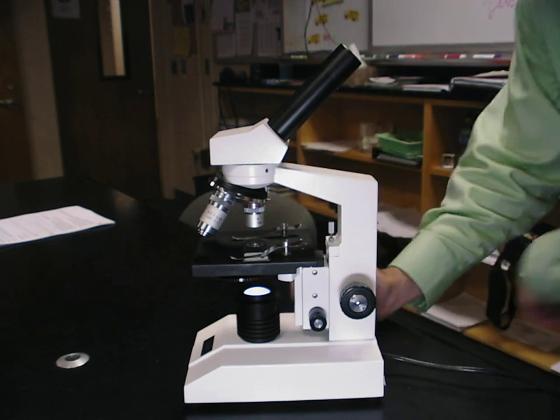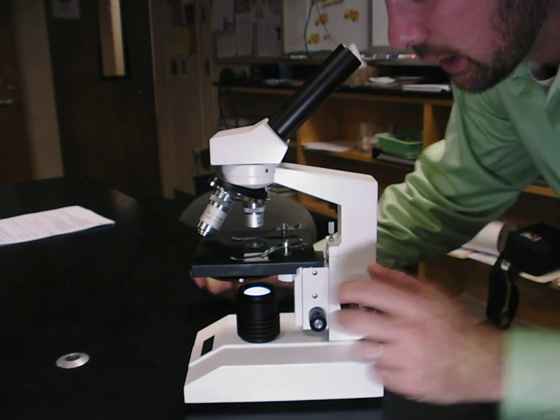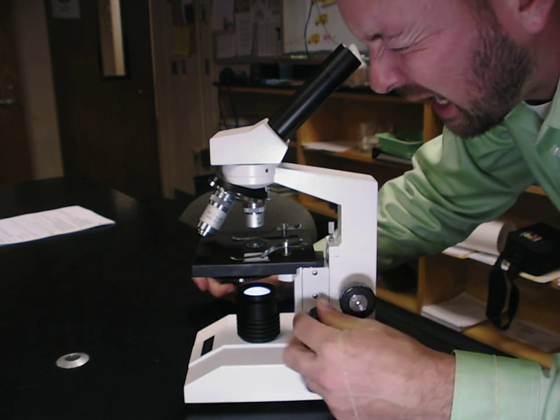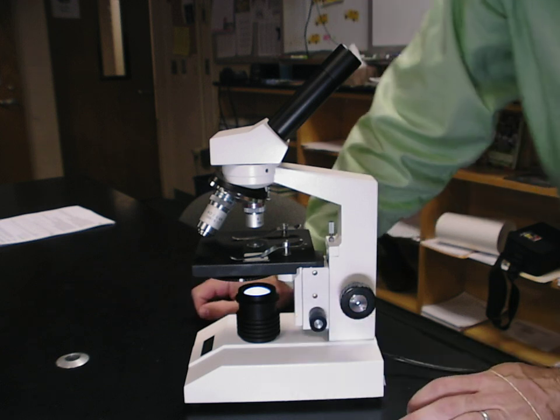Then I'm going to look through the microscope and I am going to focus away from myself using the coarse adjustment until I get as clear as I can get, then I'm going to focus using the fine adjustment until I get as clear as I can get.